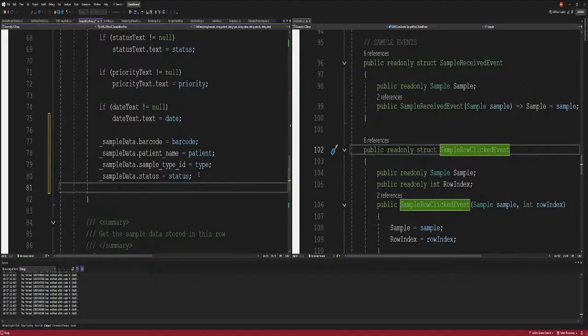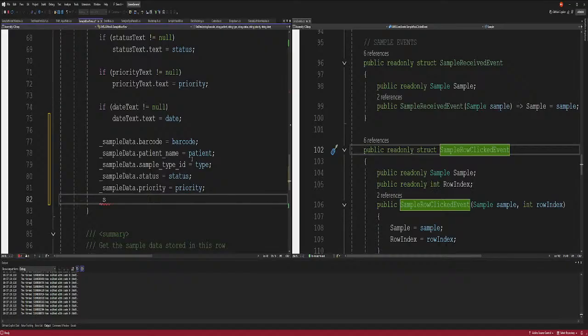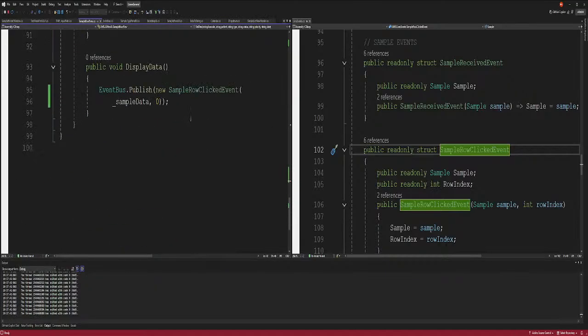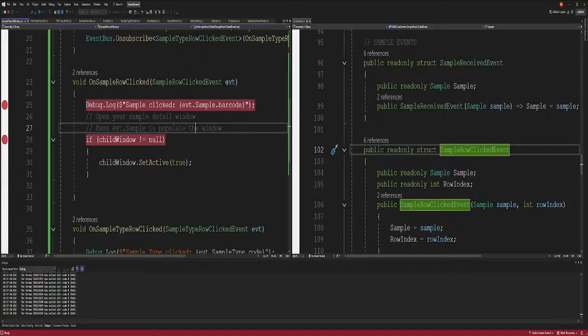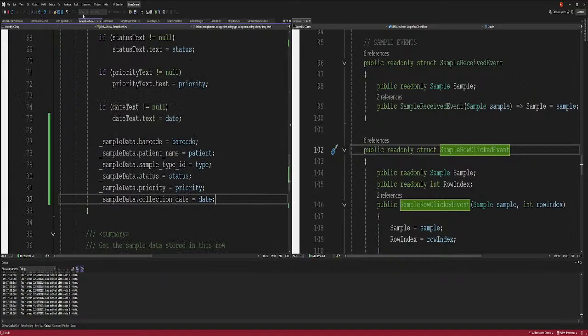All right. So then we have priority. Sample data priority. And then we have sample data date. Please tell me you got a date. Collection date, receive date. I don't know which date it is. We're just gonna say that just for now, so we can just show it to the user. All right. So we got that, and then display the data, and whoever's listening is gonna receive the data. Okay, sample barcode. Did we put in the barcode there? Let me make sure. Yeah, we put in the barcode. All right. Ready, folks? Ready.